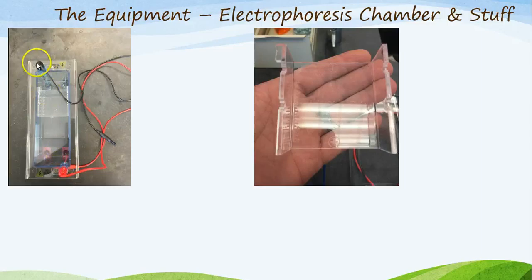You have a negative electrode indicated with a black color and a positive electrode indicated with a red color. They've dummy-proofed how you put this lid onto the chamber itself by actually color-coding the footing. If you look closely, the footing for this half is black and the footing for this half is red. If they don't match, it will not go together and it will not work. You will also notice there are cables running from each electrode. One is black and one is red. Again, color coding it for dummy proof.